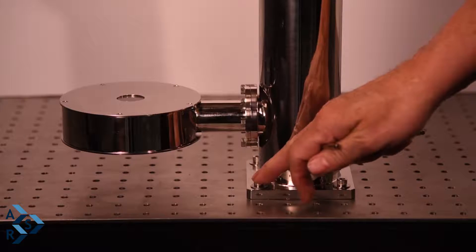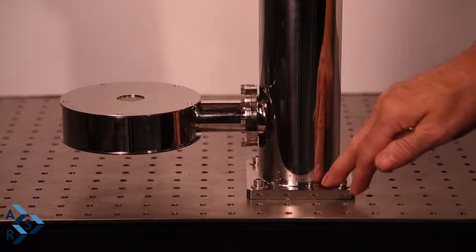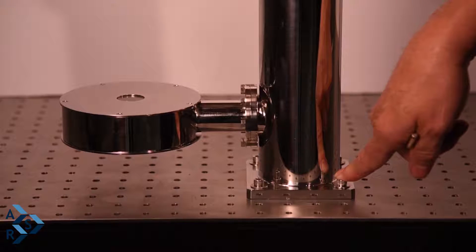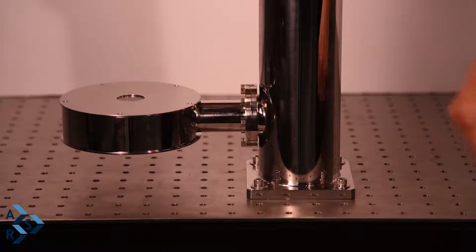The other thing is you can look online to get a torque spec for that specific screw or machine screw, and it will actually give you a torque spec. If you want to use a calibrated ratchet torque system, you can easily do that and tighten them to the expected torque.